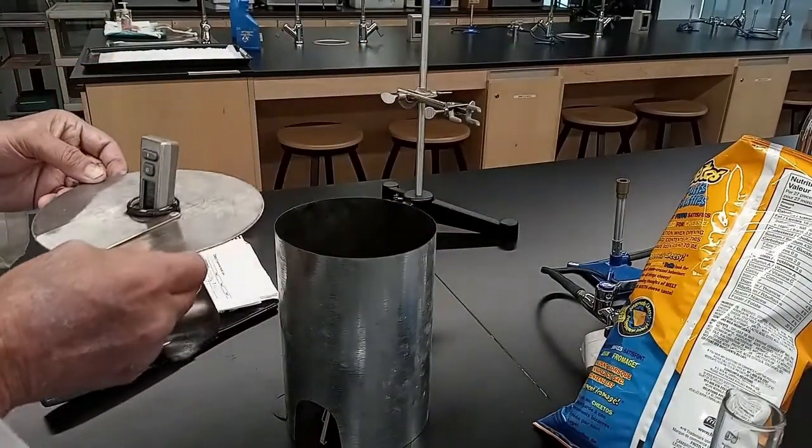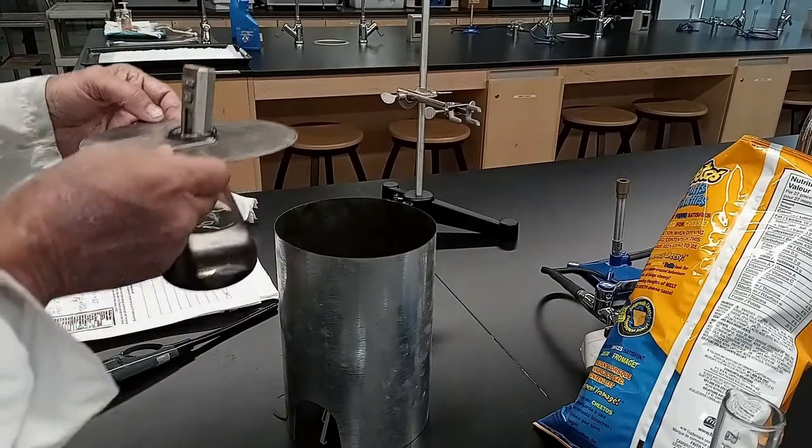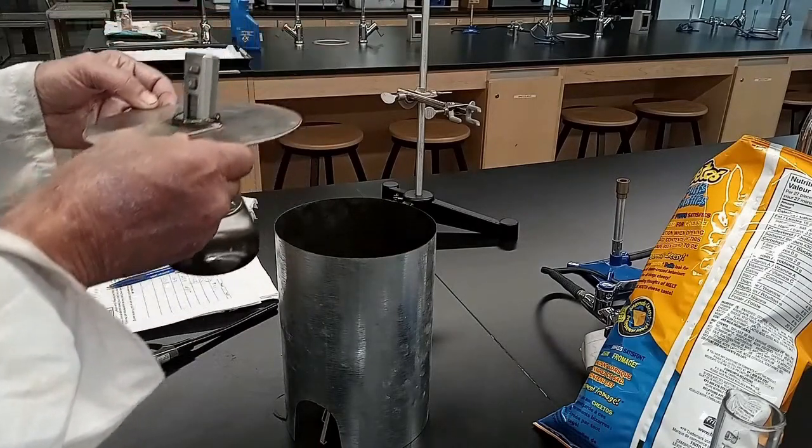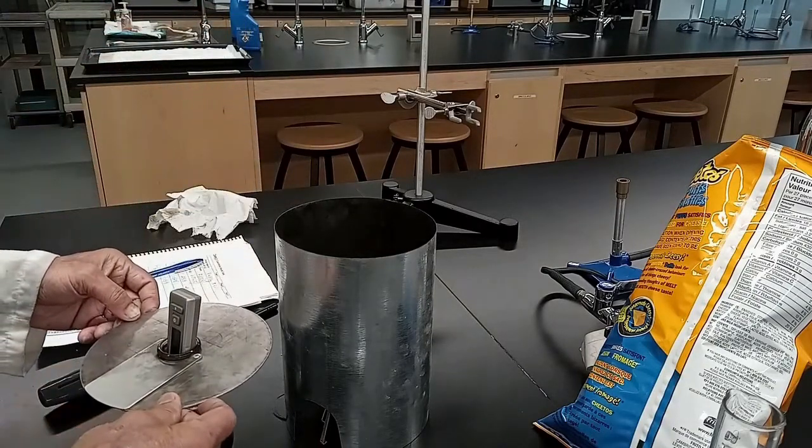Take the calorimeter out carefully. Observe a lot of carbon on the Erlenmeyer flask.